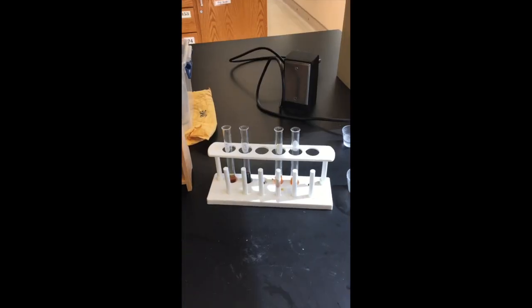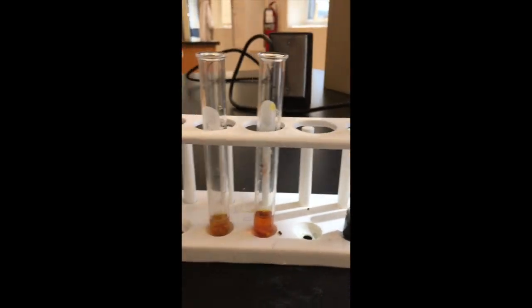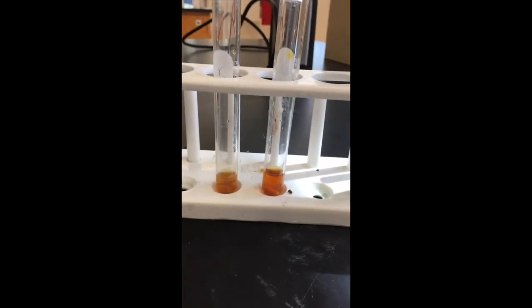Okay. Over here, we have iodine potassium iodide, IKI, and this tests for complex carbohydrates. A negative test is this reddish yellow color, this lighter orange reddish yellow. A positive test for complex carbohydrates or polysaccharides results in a deep blue color.